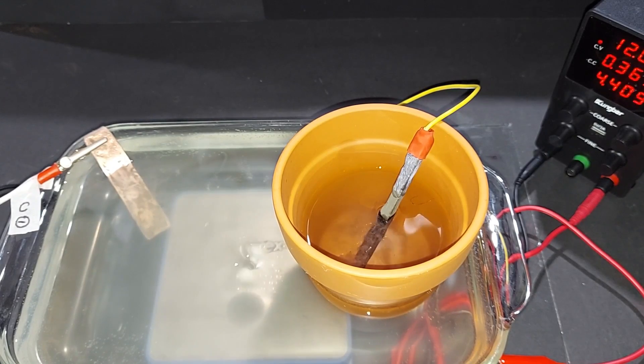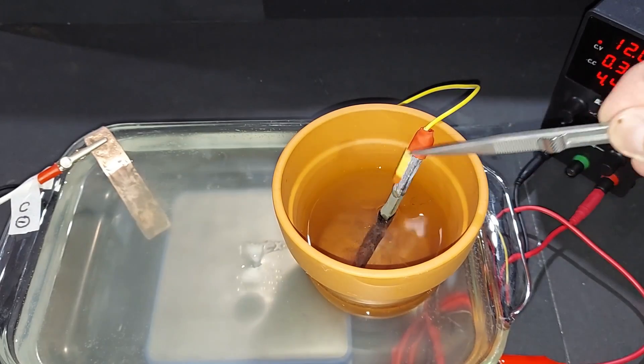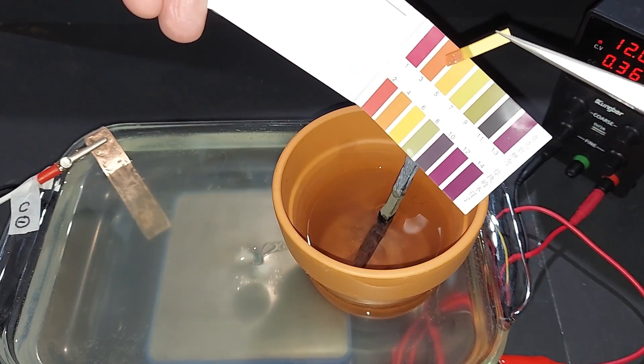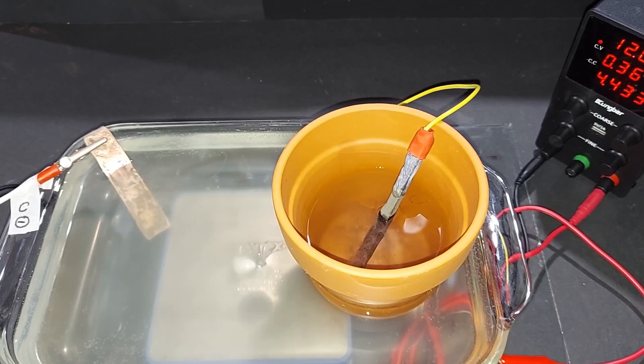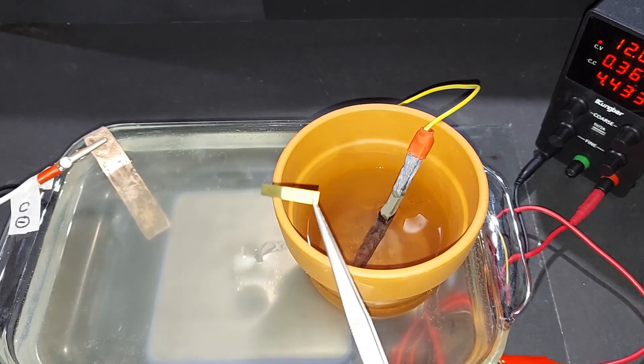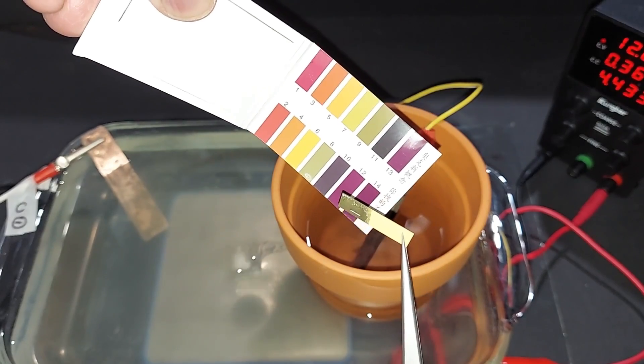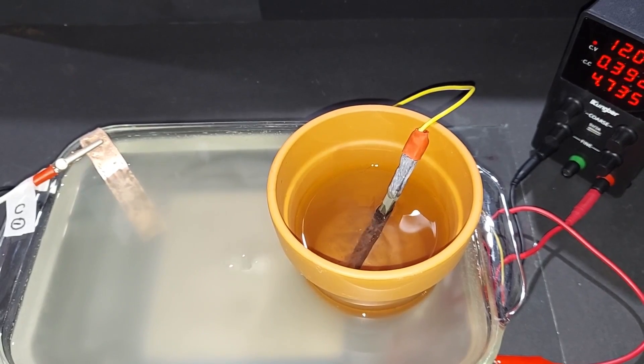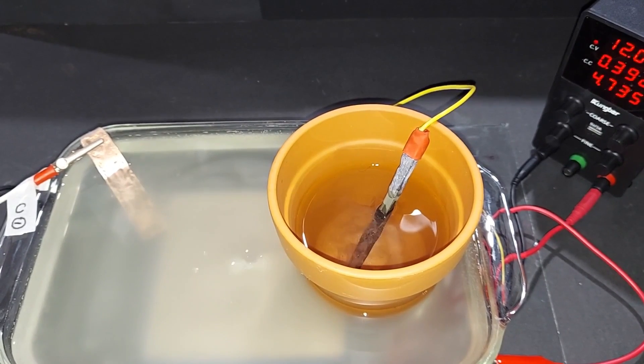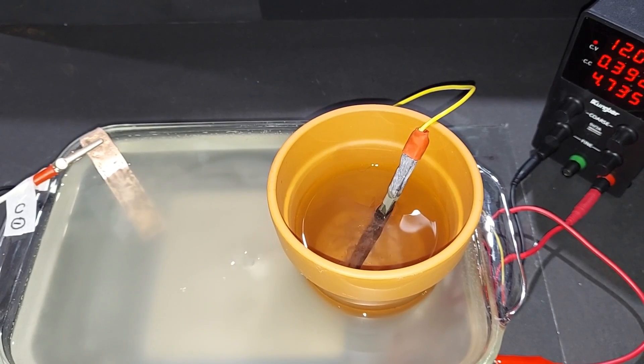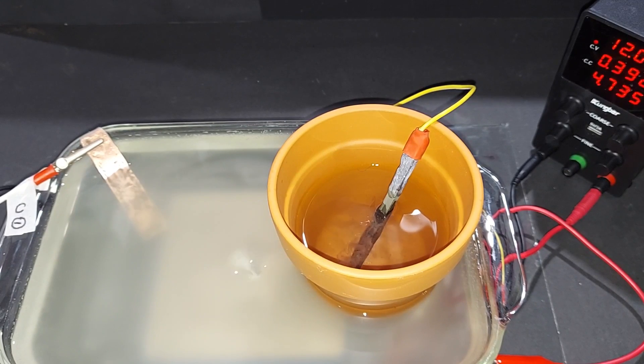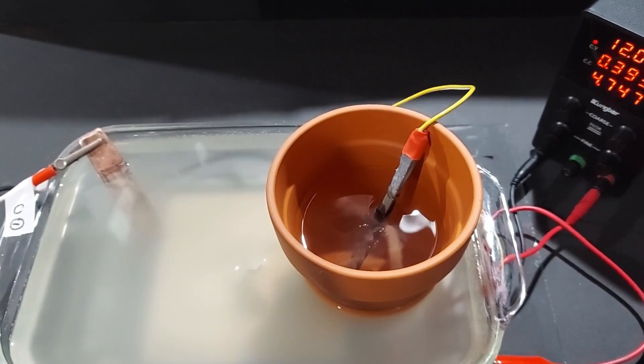Checking the pH in the sulfuric acid pot, we've got some good red, which is what you're looking for. I'd say that's about a 3 right now. The magnesium hydroxide side is around 9 or 10. Three hours out and this is cooking. There's a lot of bubbling. The amperage continues to rise, so as long as it keeps going up, we know we have ions being switched. Here's a red laser going through some soupy magnesium hydroxide.